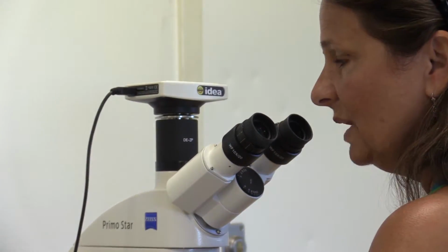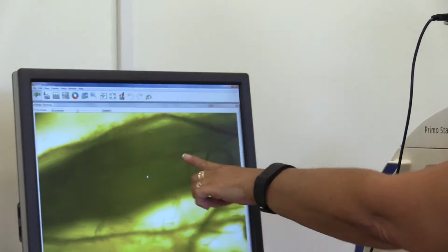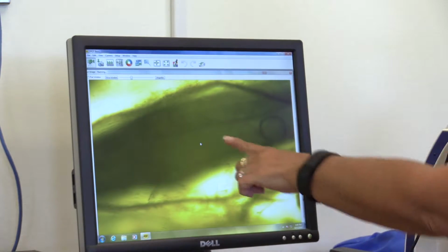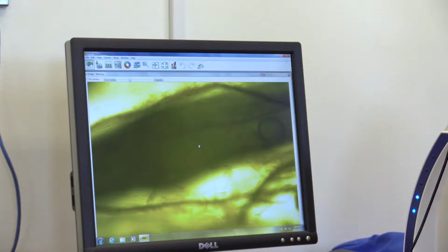And what I'm finding is there are some structures here that are from fungi, and this is what's causing the symptom that I'm seeing in the field. And so they look really subtle. They look like they wouldn't be much of a problem, but unfortunately they are.